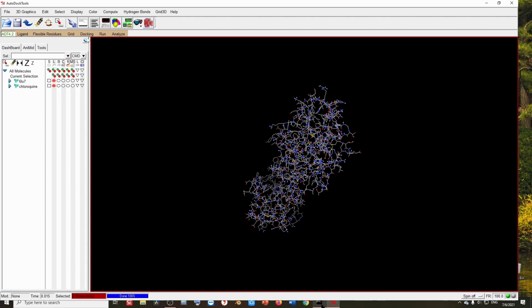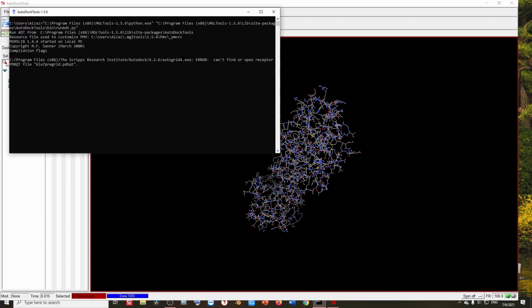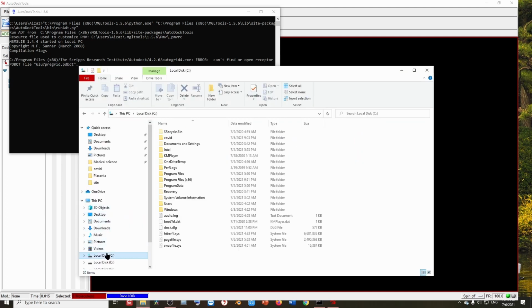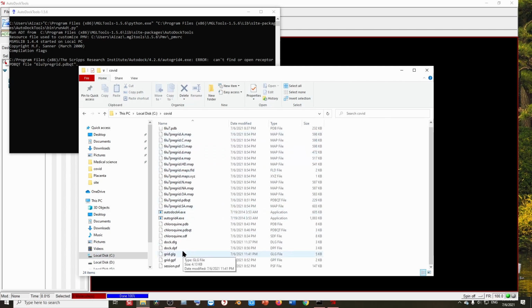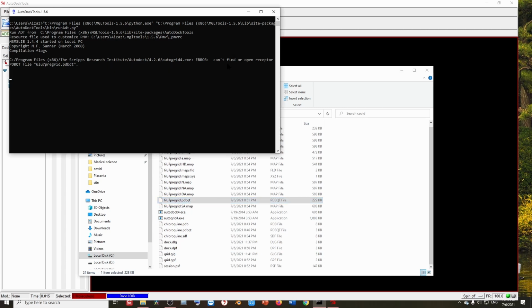Oh, what happened here? There is some error. The error says cannot find or open receptor PDBQT file. Well, what's going on? The file is actually there. If you go to this folder, it's talking about this file. Yeah, it is there, here is that file. So it is there, but it is saying that it cannot find or open this file. Let's try to solve this problem.